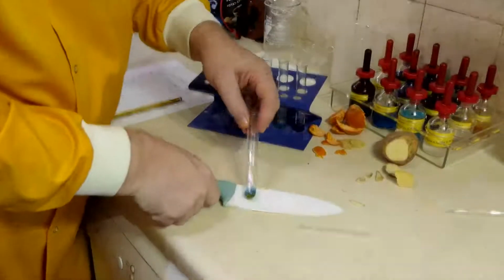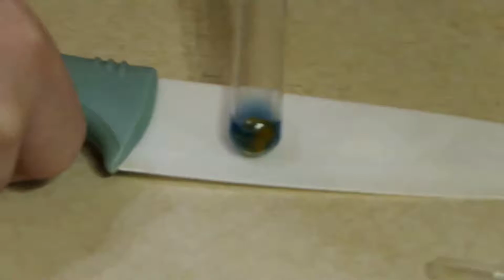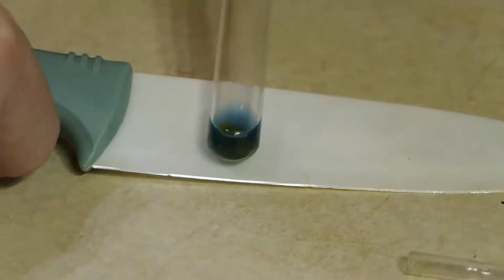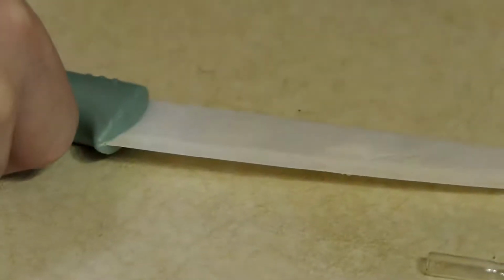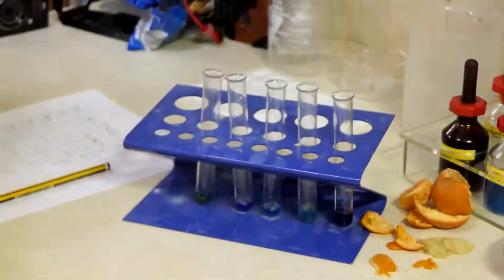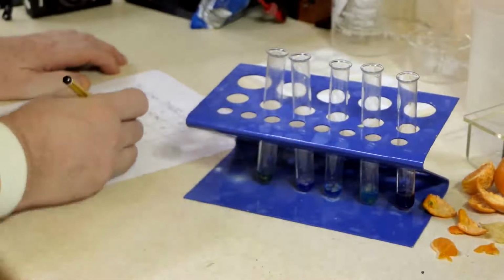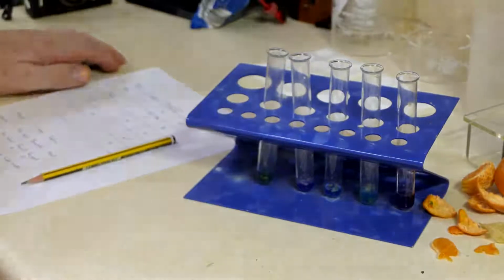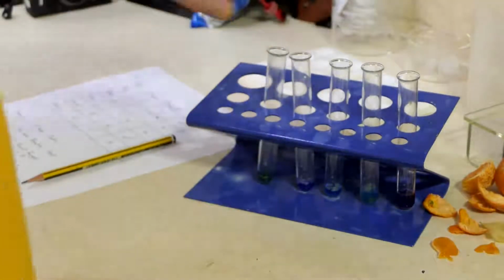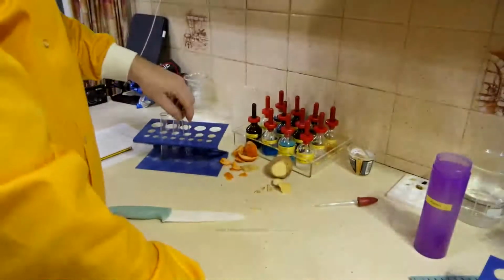And my Satsuma. Trying to look where there isn't sort of the orange Satsuma. I'm not really convinced there's any protein in there. There might be a tiny bit, but I can't really see it. So there is my second set of liquid tests done. So I'll move those away.